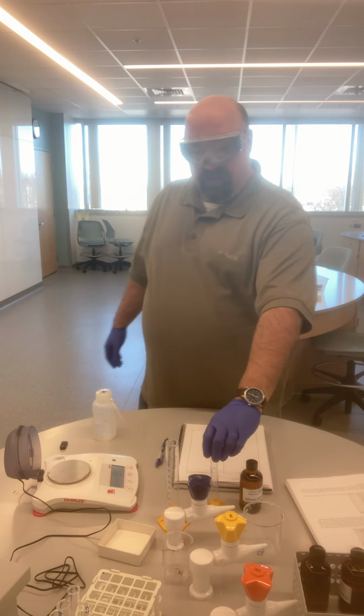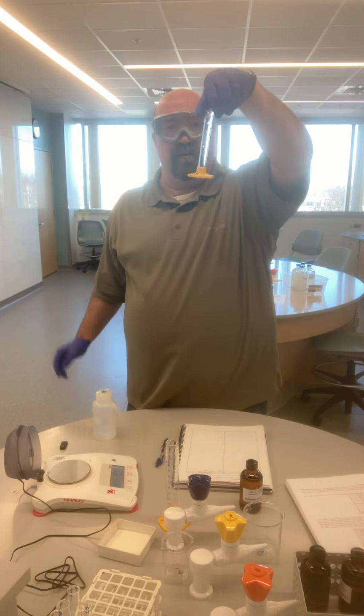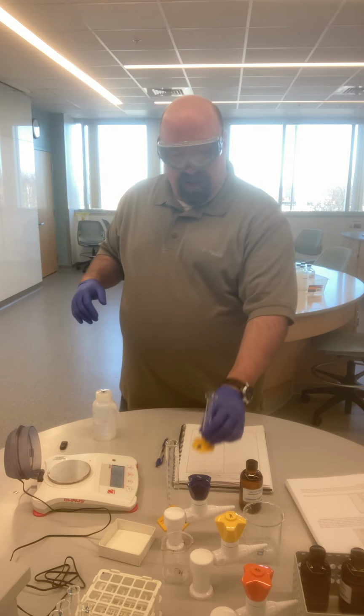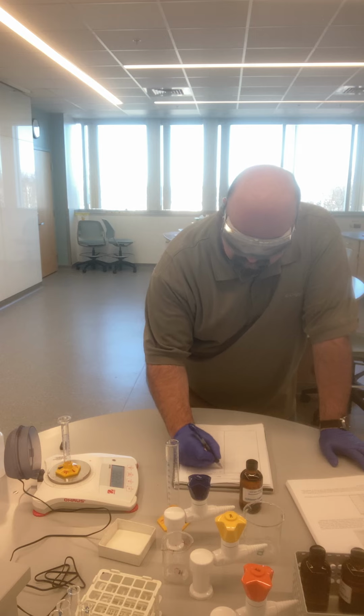I can find the volume easy enough by putting some into a graduated cylinder, and I measure the volume. But then I need a way to find the mass of that. And I obviously can't simply pour some onto the balance and find the mass of it that way. And so hopefully you thought about this in your pre-lab, the steps that you would actually take in order to find the mass of this liquid. What I'm going to do first is zero out my balance. I'm then going to place my 10 milliliter graduated cylinder onto the balance.